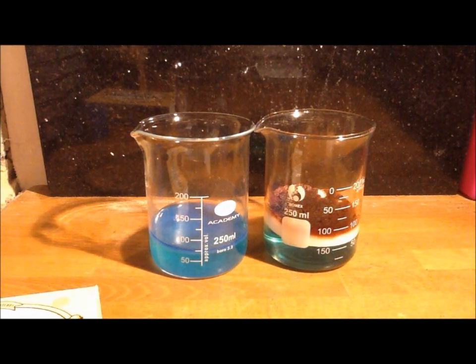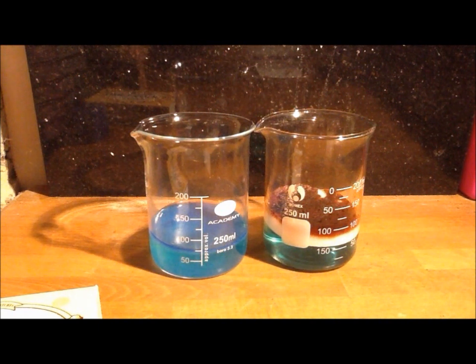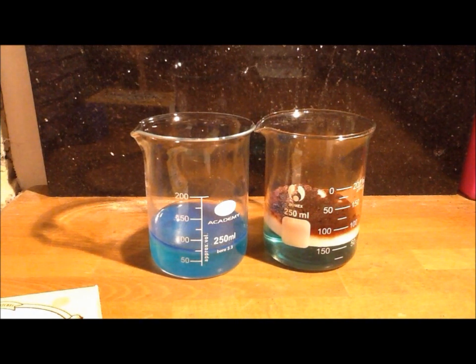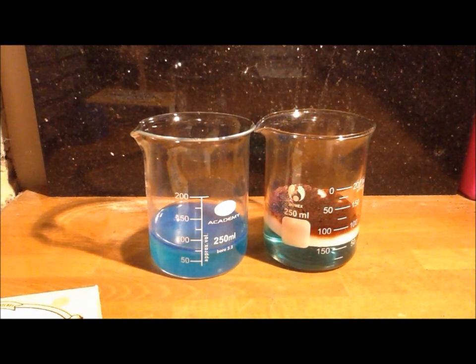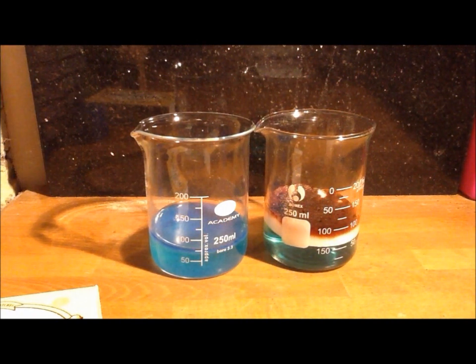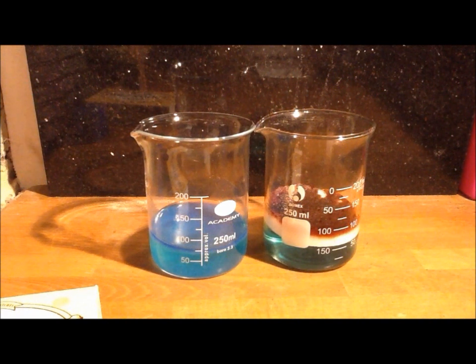If potassium permanganate is added to hydrogen peroxide, as seen in my previous video, it will react vigorously to form oxygen gas, which can easily be detected by a glowing splint. But I think there's already confirmation, as seen on the right, that the reaction has taken place.